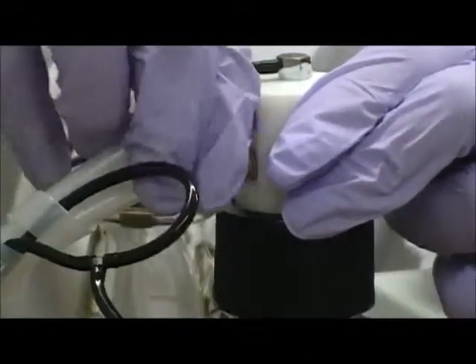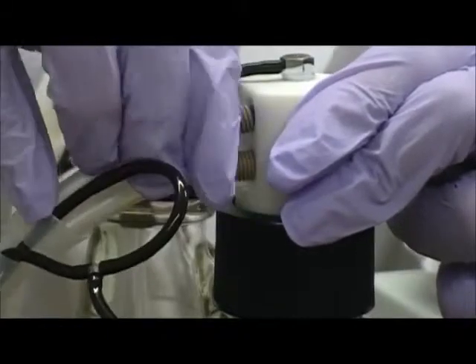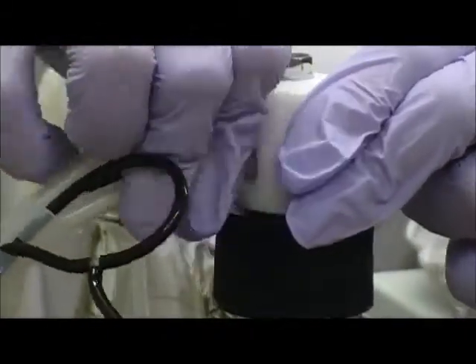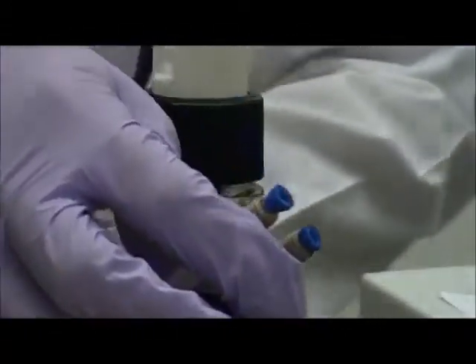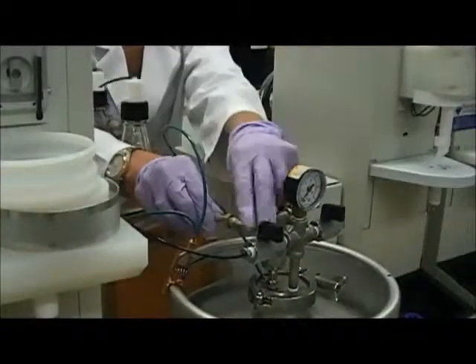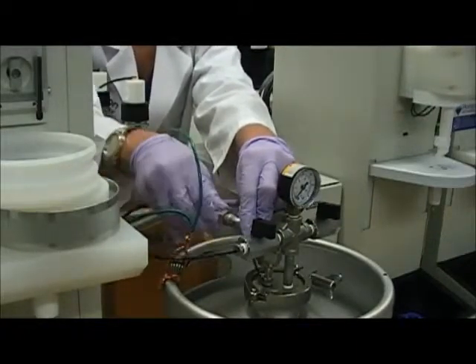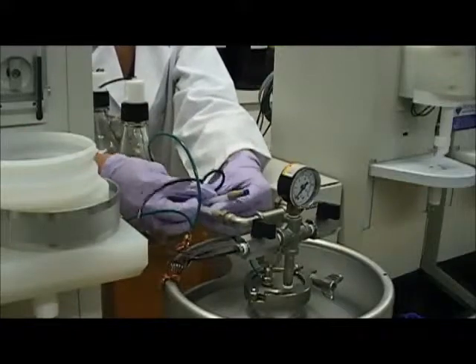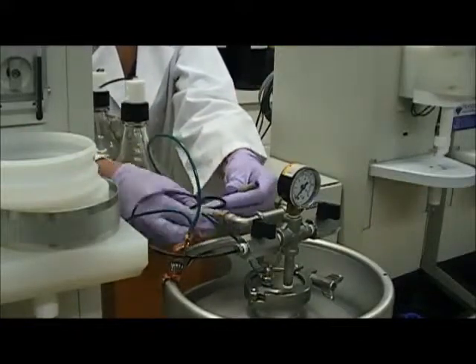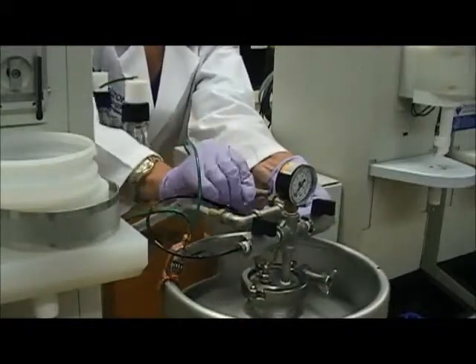Next, we'll transfer the solvent lines from the plastic coated solvent bottles to the new solvent delivery system. Unscrew each of the connectors from the bottle and transfer them to the solvent delivery system metal connectors. You may have to uncurl a little bit of the tubing wrap in order to have enough to grab onto.